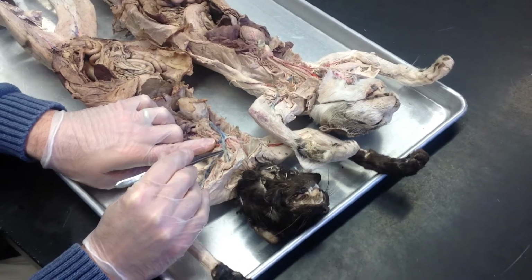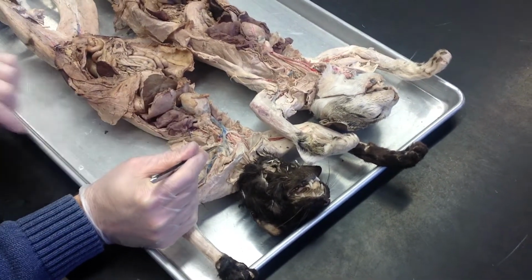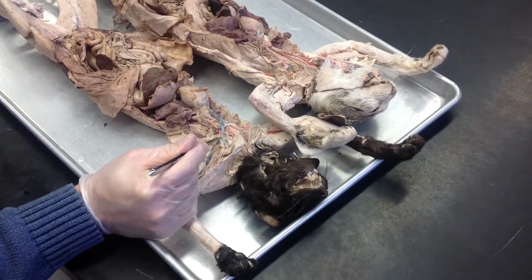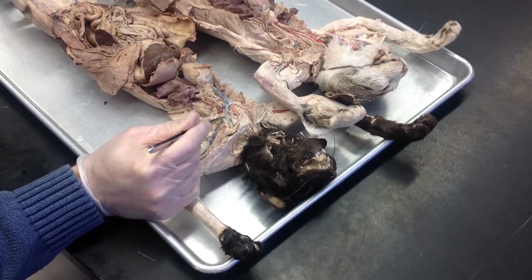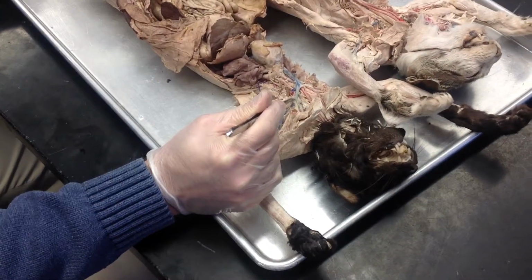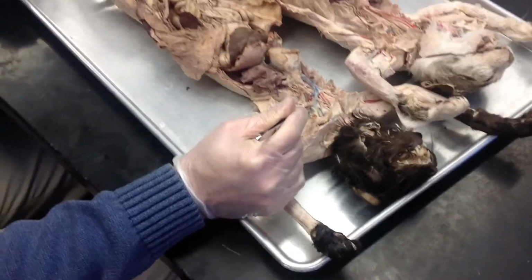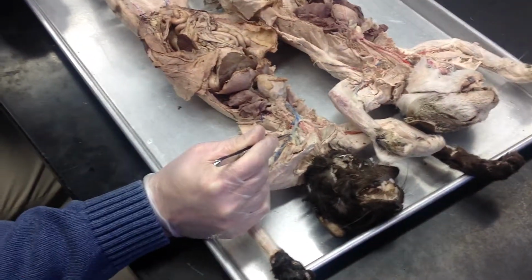Now, if you see this, oh, look at this brownish, what the heck is that? Let me just clear that out. That's actually something I want to mention next time. That's a lymphatic vessel. So just right here where the brachiocephalic vein starts, don't be too liberal with ripping stuff out. You might see something that you wanted to see next week.